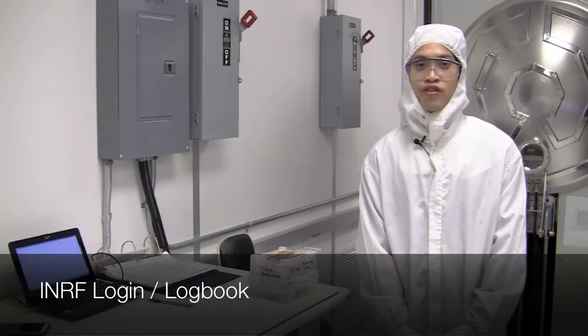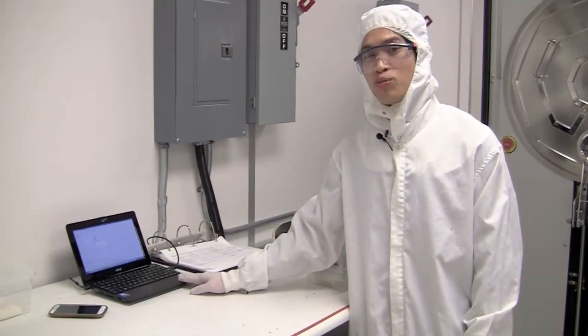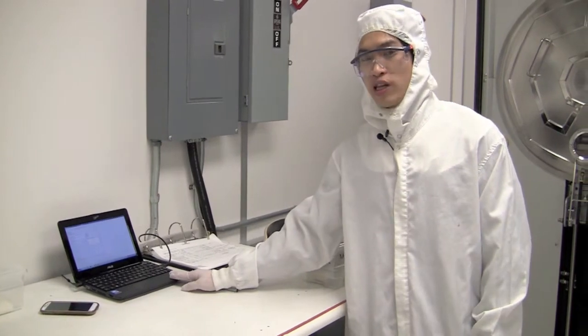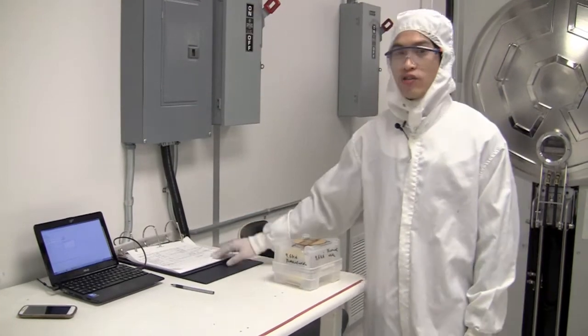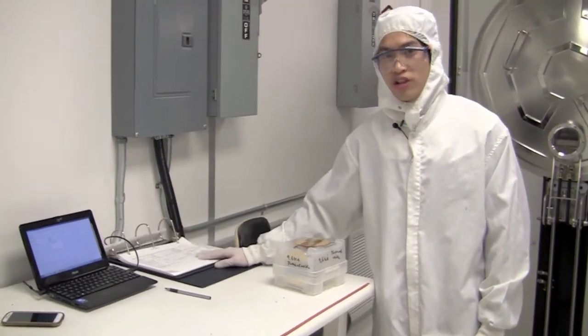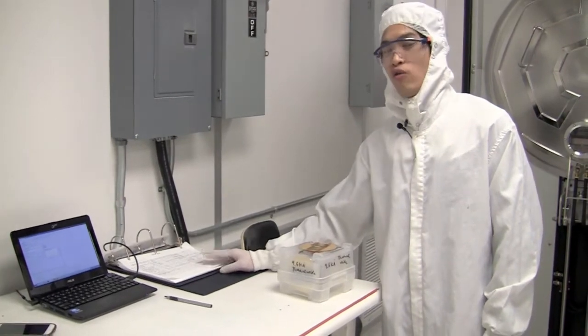After verifying that the Mark 50 is ready to use, you want to first sign in on the cleanroom computer. You can do this by logging in with your username and password. In addition we want to start filling out the logbook. We're going to be filling out the logbook throughout the whole deposition but it's a good idea to start filling it out right at the beginning.